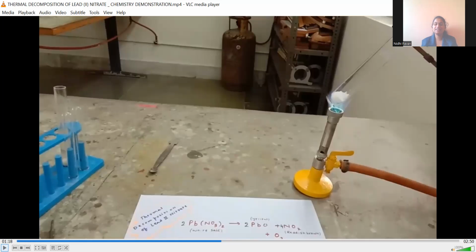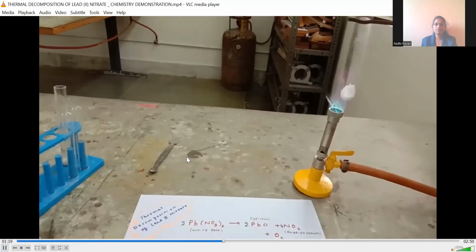While heating in the laboratory, the test tube should face the wall. It should not face any person beside you, or your own face. The mouth of the test tube should be faced towards the wall, so that if a poisonous or toxic gas is a product of the chemical reaction, it will not be inhaled by you or create problems for others. So always hold the test tube towards the wall whenever you are heating, and don't perform this activity without a teacher. This activity should be demonstrated or practiced only under the guidance of a teacher.